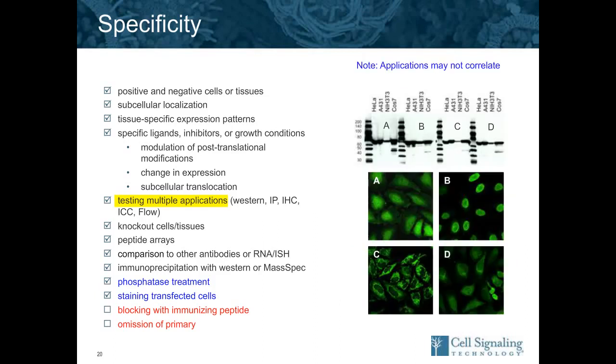This is one example where the Western blots actually looked very clean. These are real data. These are four different clones that we were testing here, with Western shown from four different cell lines. And they all look pretty specific, but when you look at the localization down below, you can see they're all very different. Some are restricted to the nucleus. Some appear to be mitochondrial and different mixes. So this is a great example where the combination of multiple applications can really tell you a lot more about an antibody.